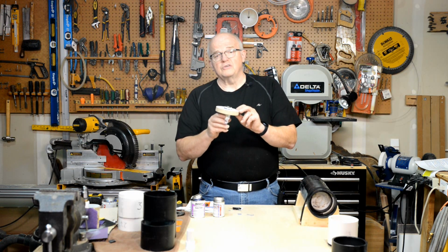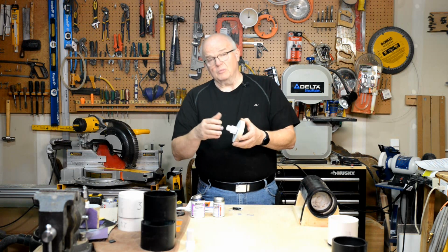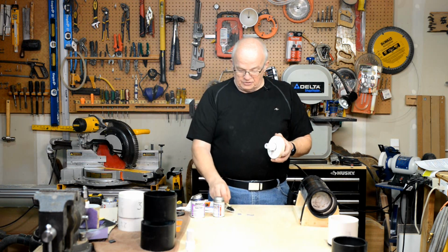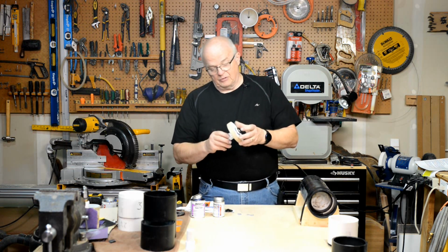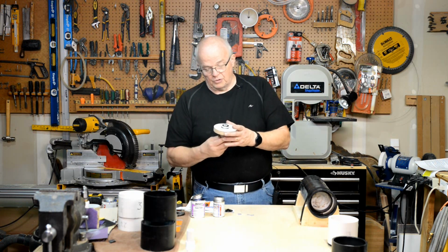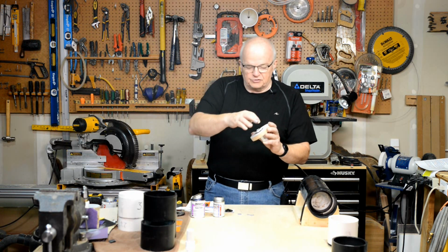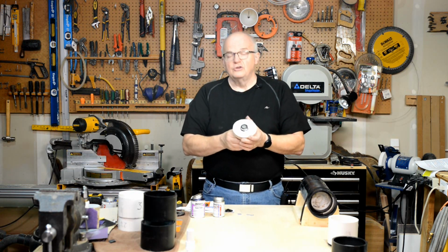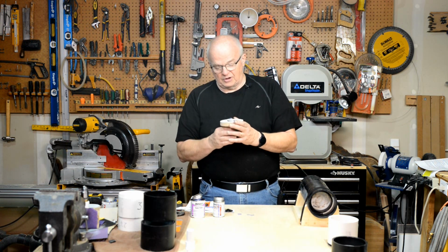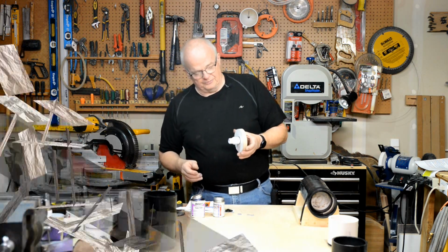I want you to pause and get to this point, and be sure, if you're not sure about something, you come back before you mix up this epoxy and watch this video. You might want to watch it 2 or 3 times if you're unsure of what's going on. Again, avoid the temptation of running your finger or something, trying to smooth that out. Don't do it. You've got a good seal there. You might just make things worse, and you're going to make a mess out of everything. So with that, pause it here and get to this point.